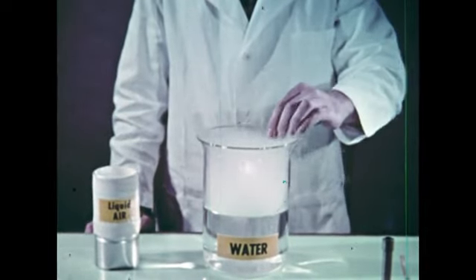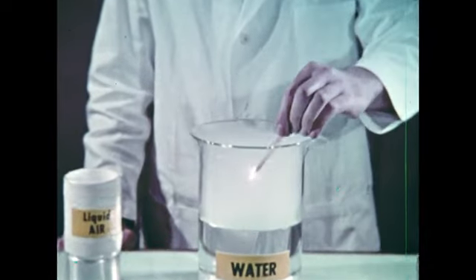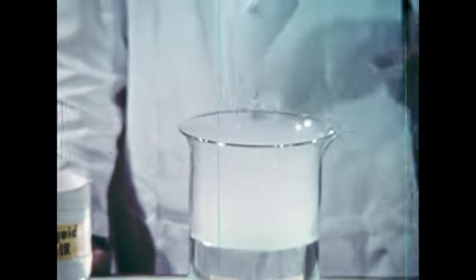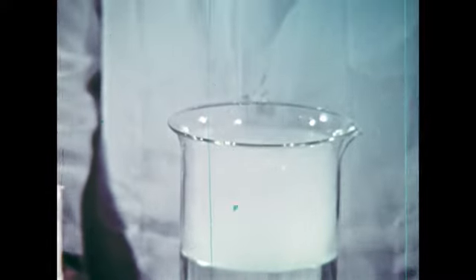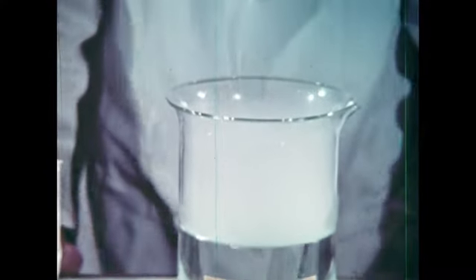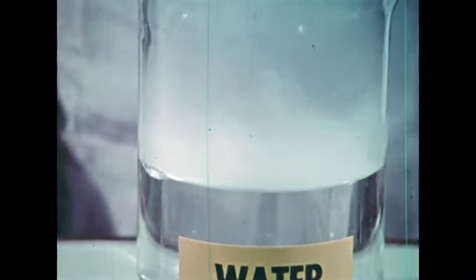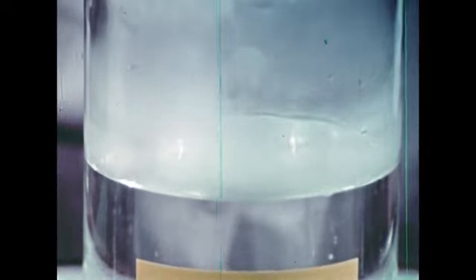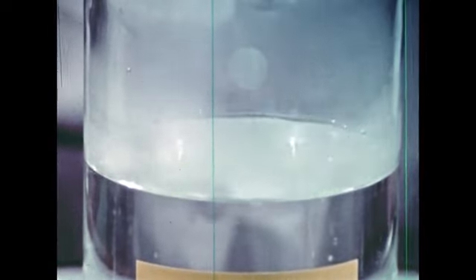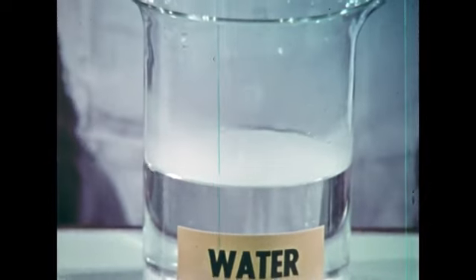This is the chief industrial method because it uses the least energy and the cheapest material, namely air. Oxygen is usually made on the spot because storing it is a problem, although it does come in gas tanks for labs and is shipped at low temperature in liquid form called LOX for industry. We're blowing the vapor out so you can see the remaining globules of liquid oxygen skittering around on the surface of the water.